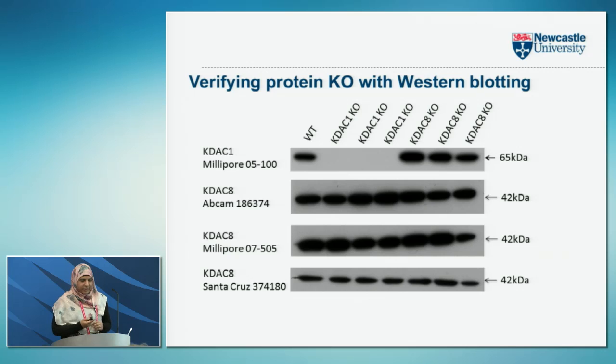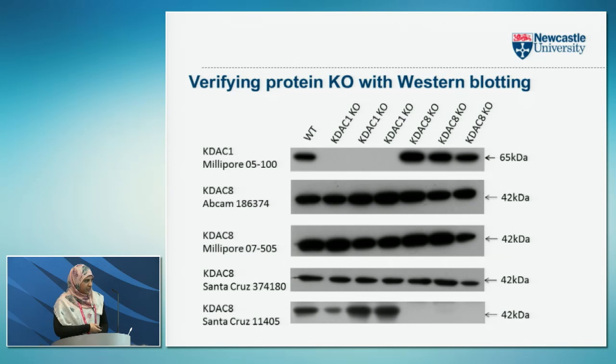And their local collaborators had mentioned that there was a problem with these KDAC8 antibodies, and they suggested one that they were more confident in. And lo and behold, it did show knockout. So we still needed a bit more convincing.